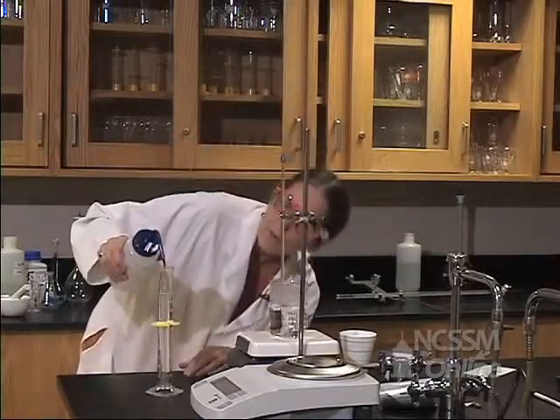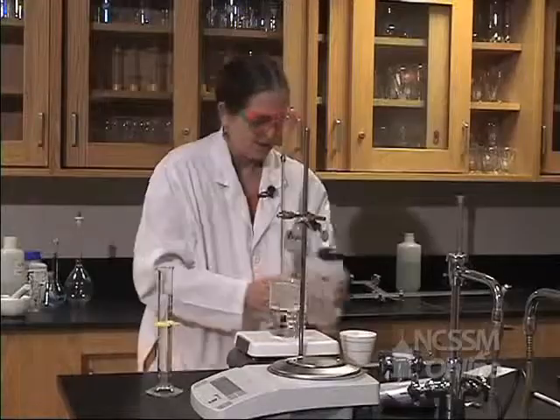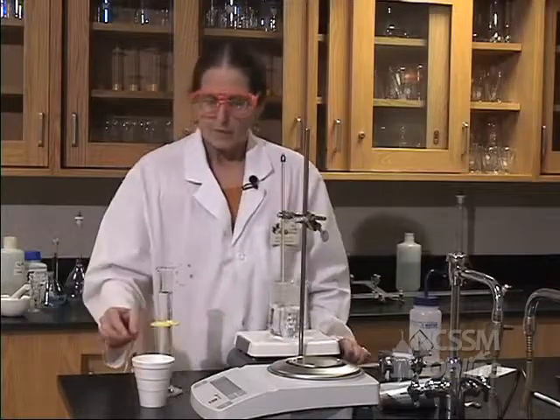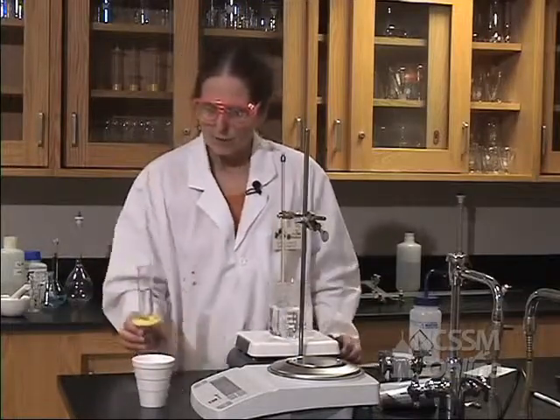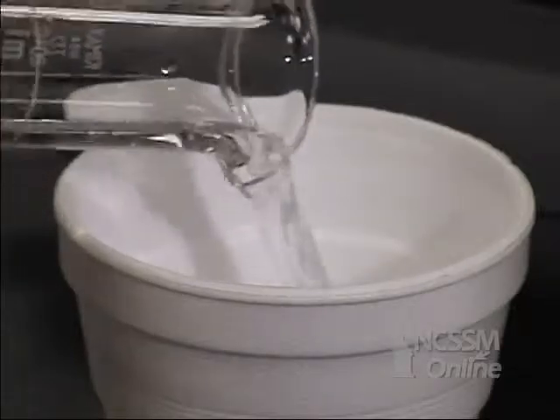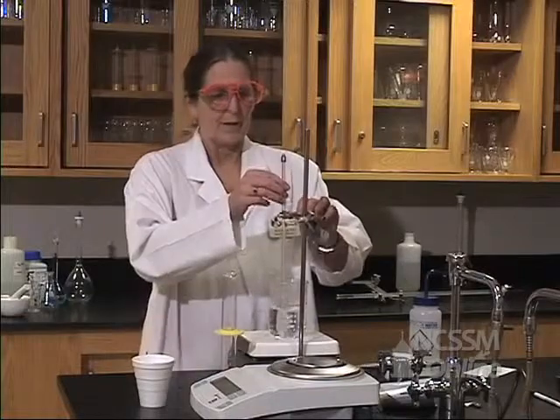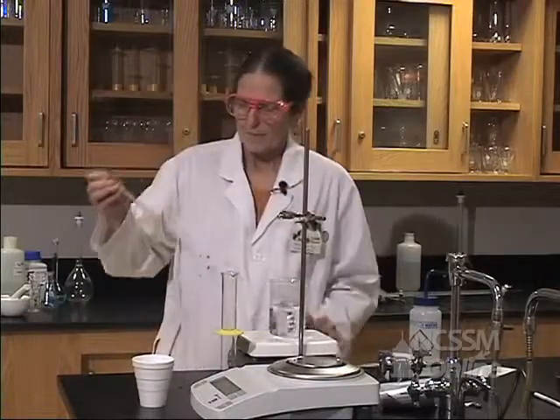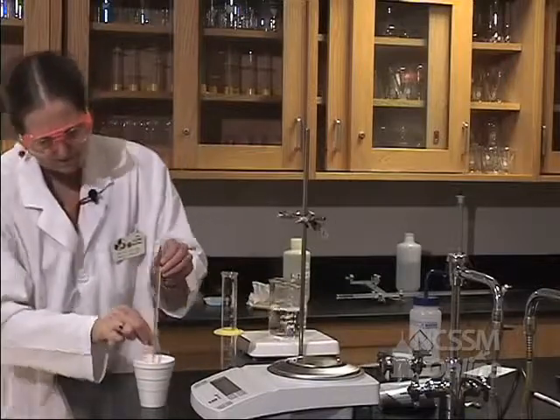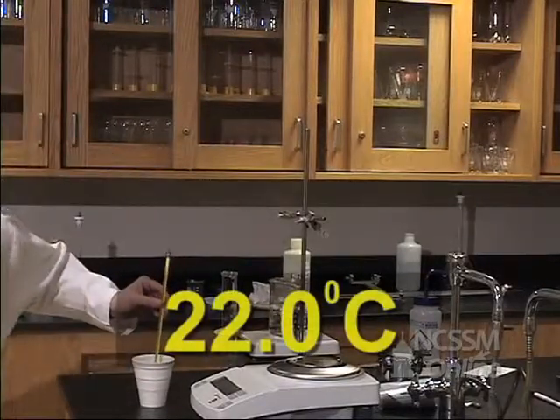So we know that when we put this hot metal in there, it's going to gain heat. We're going to use our coffee cup calorimeter because it's insulated, and we're going to assume that it gains no heat, and the water gains all of the energy that's given off by our metal. So let's find the temperature of our water, and the temperature is 22 degrees Celsius.